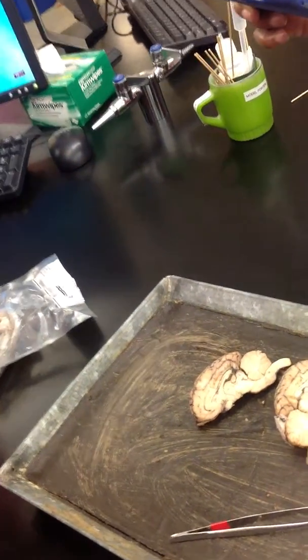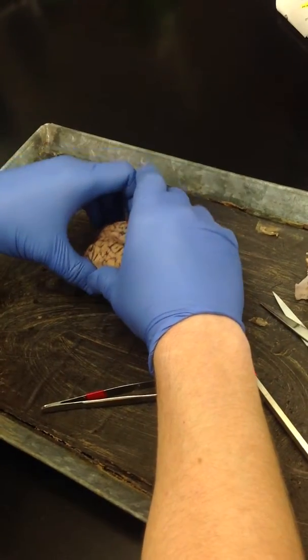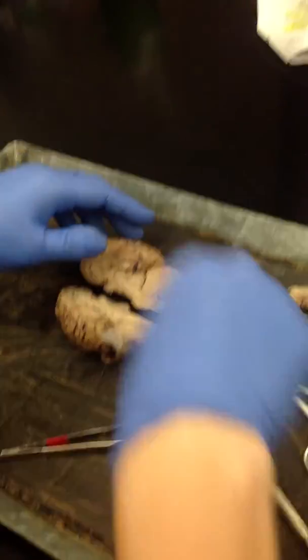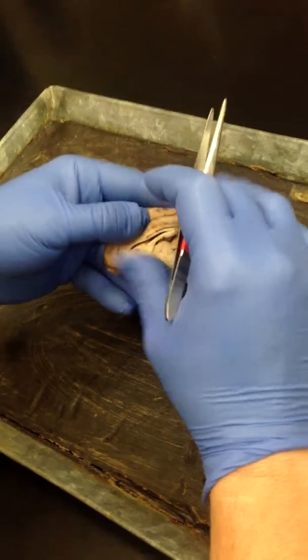What about the other nerves, like oculomotor nerves? Only from the figure. Only from the figure. Show again the corpus callosum and the fornix. Fornix, you don't need to know.